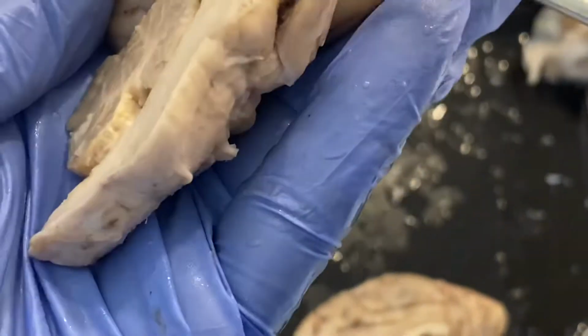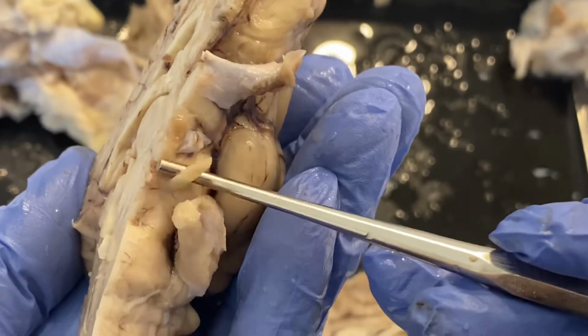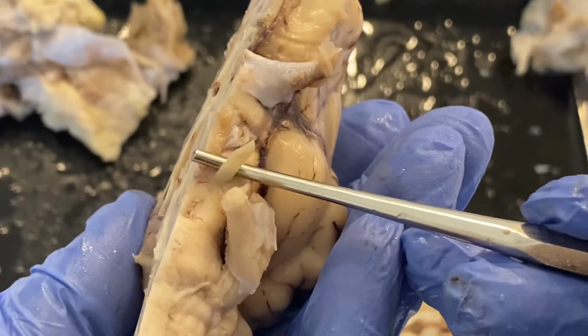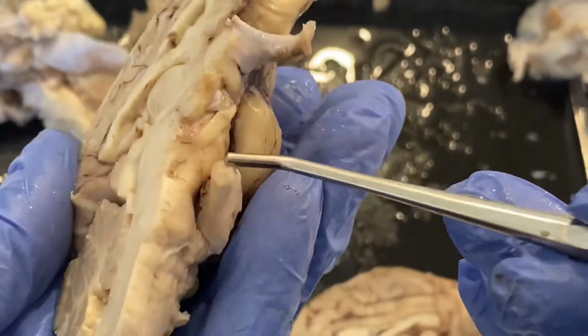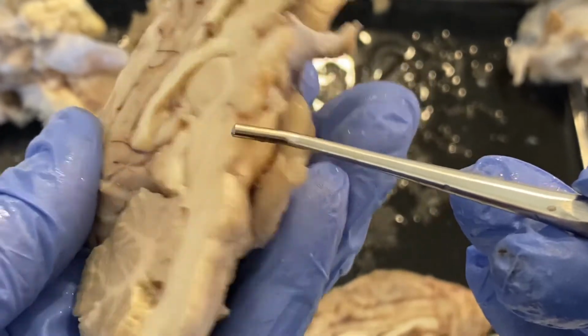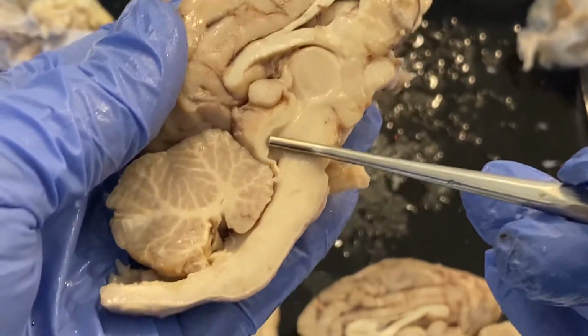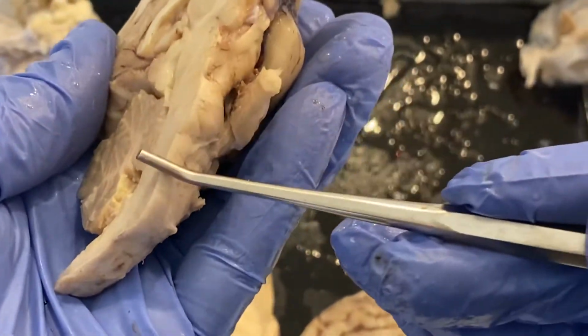And on the inferior view, remember we had that oculomotor nerve, okay, right here. So that oculomotor nerve is part of the midbrain, if you see where it is innervated right there, okay? So this whole region here is the midbrain. It leads down into this swelling, this area right here.